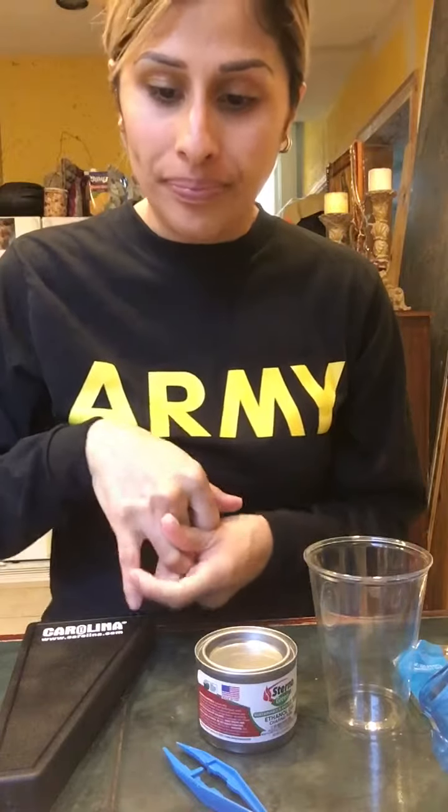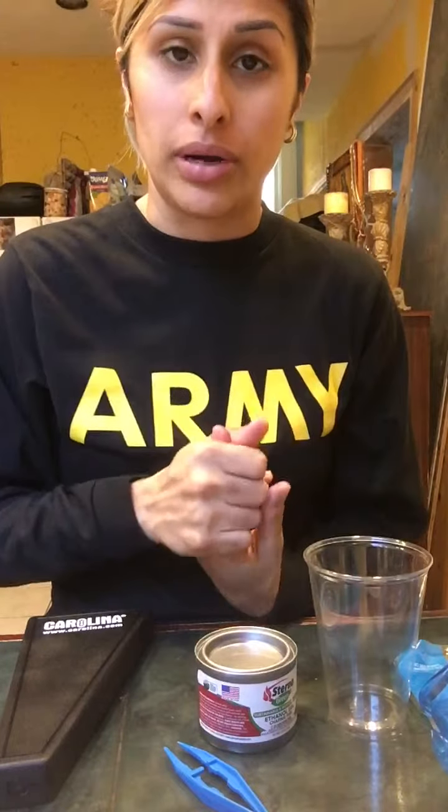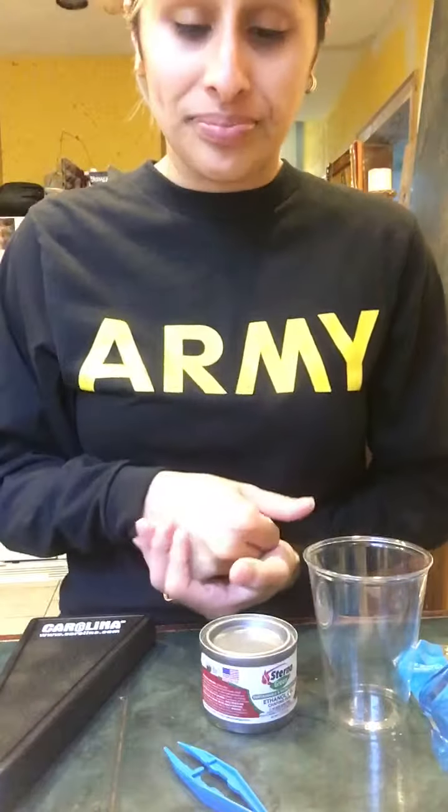And then I will do the exact same for all the sticks on here, which are the lithium chloride, sodium chloride, and copper chloride, and a mystery ion as well. So I'm gonna record what I'm seeing on table number 3.